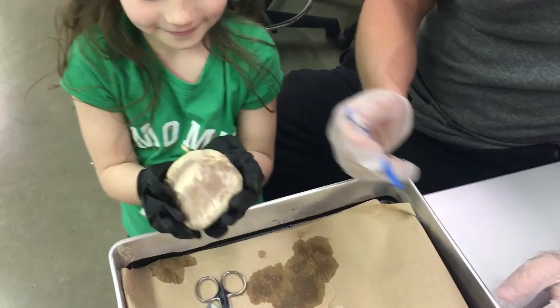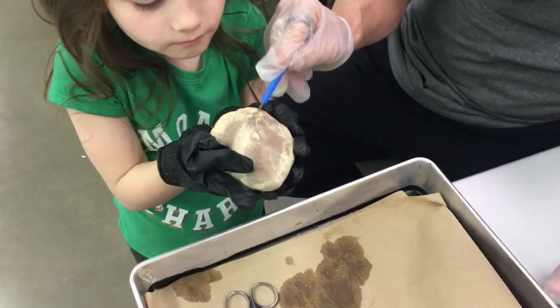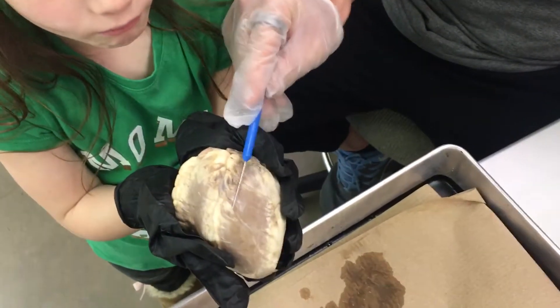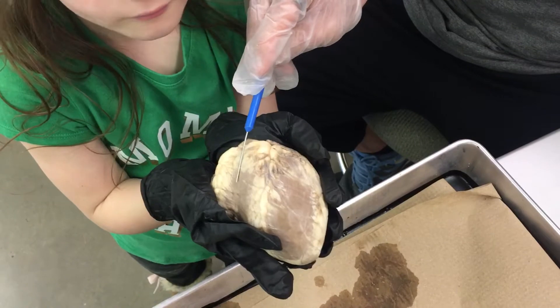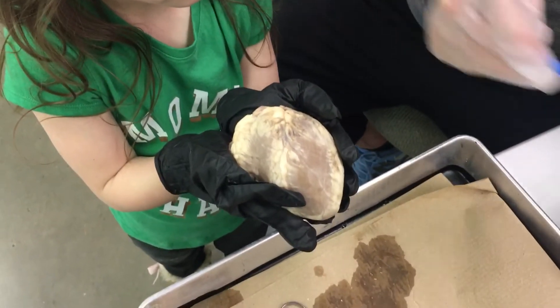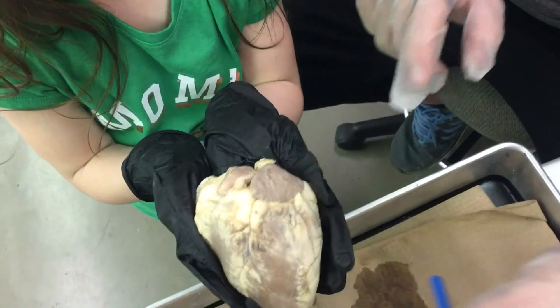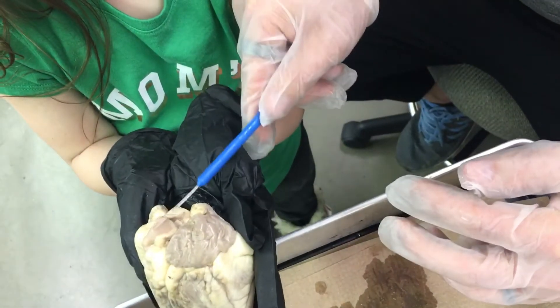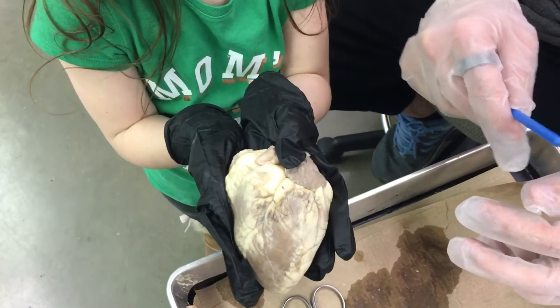This is the anterior or front side of the heart. You can see there's some adipose tissue. This big area here is the left ventricle, this area here is the right ventricle, and then you have the atria up here. This little area right here is called the auricle — its Greek or Latin root means ear — and you have some of the great vessels coming off the top such as the aorta and the pulmonary trunk.